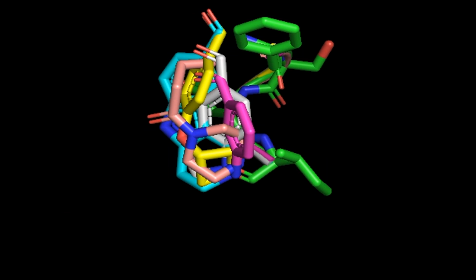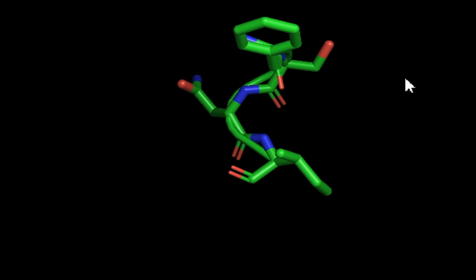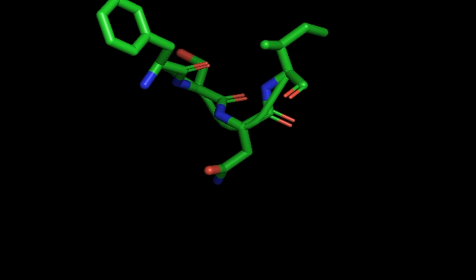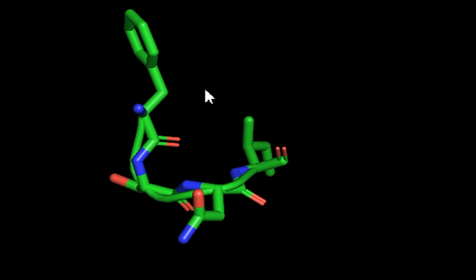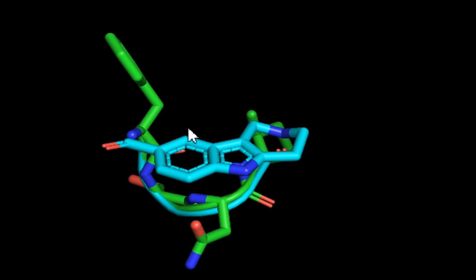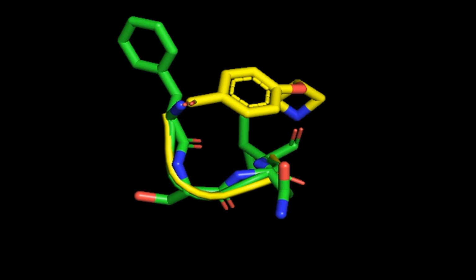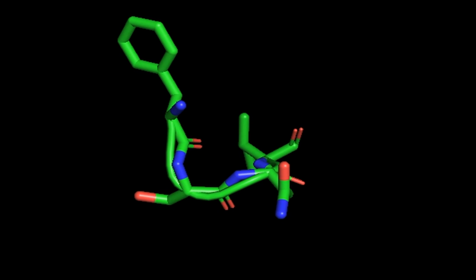The first one finds the best overlay result for the loop fragment 25 to 29, and we use 4 alanine cyclo-organopeptides to do this. This is the loop fragment, and we can find the best overlay hits like this, like this, like this. Again, the choice of linkers is solely determined by the user, considering different properties and requirements.